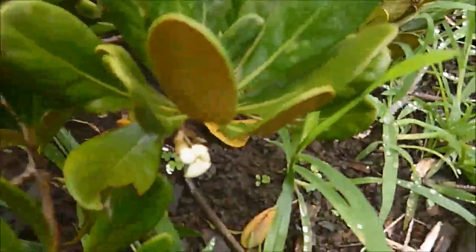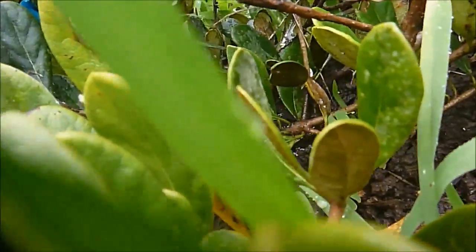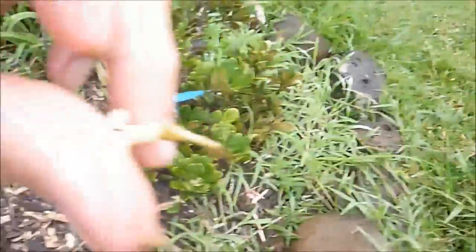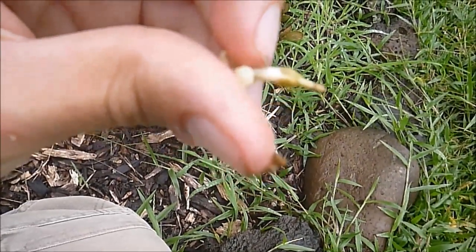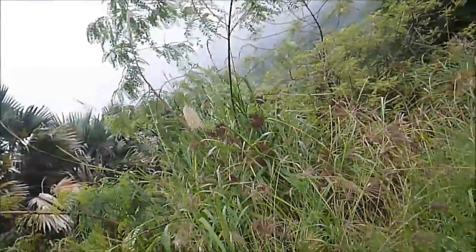It's very easy to just collect the flower, because I just want to check and see if the pollen has been released. And it looks like it has, so we'll just pick the flower right off at the base, because if you pick them too high you don't have anything to hold on to when you're processing the pollen. So it'll be really good to collect the pollen, and I'll show you how to do that in a second.